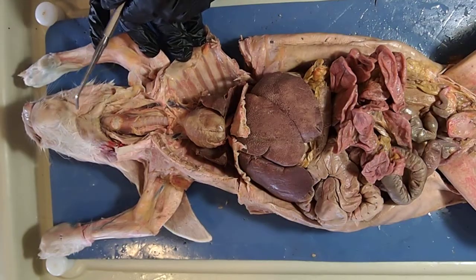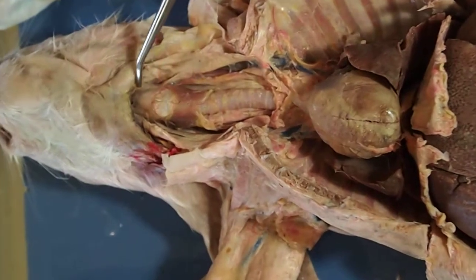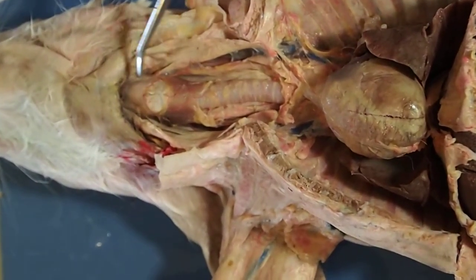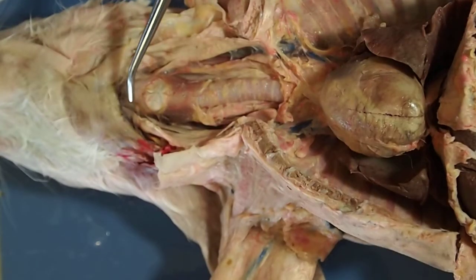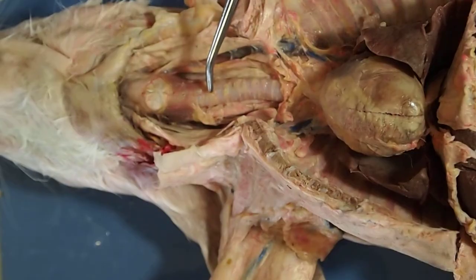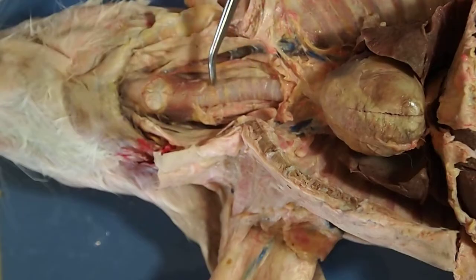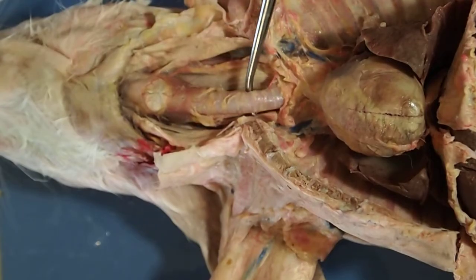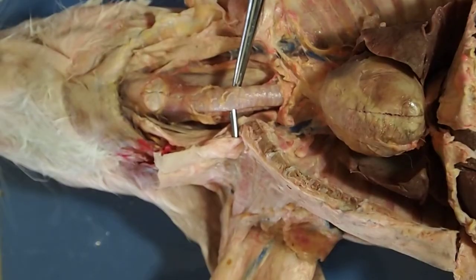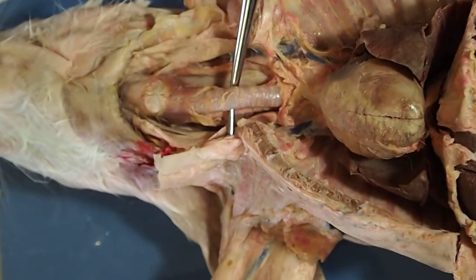Starting up here in the thoracic cavity, the first thing I want you to notice is this large swelling right here. This is the larynx, which is the beginning of our transition into the trachea. The trachea is kind of like a bendy soda straw you might have had as a kid — here's the trachea, often called the windpipe. This is the path of air as we move into our respiratory system.